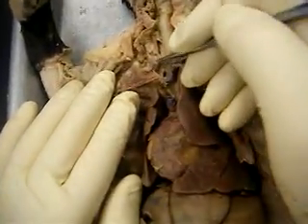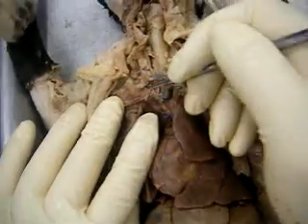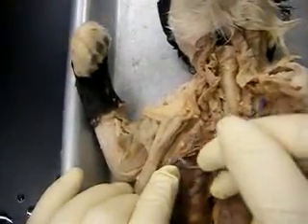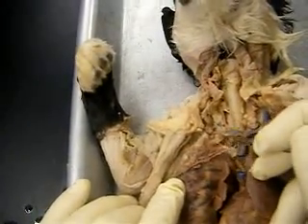I know it's a lot of words I'm throwing at you, but it helps to see it. Maybe it'll come back to you. But again, the mammary one runs down into the breast tissue. And that comes off that right subclavian.